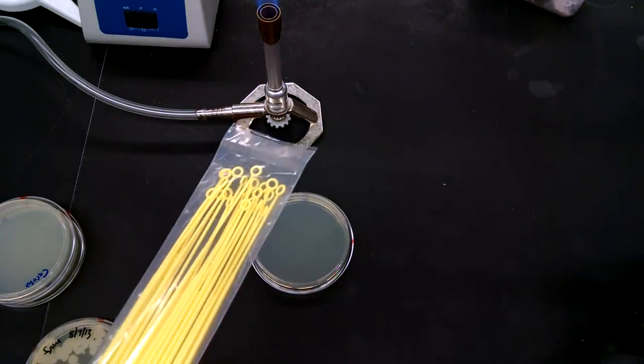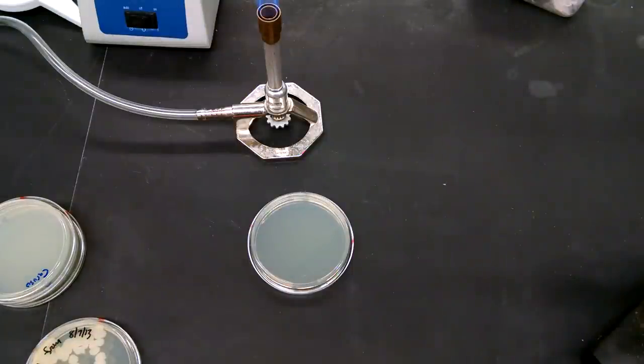In fact, please don't flame them. They'll melt in the flame. But the procedure is only slightly different.